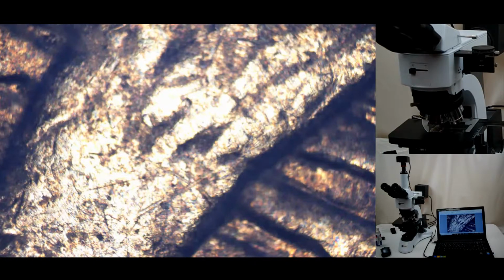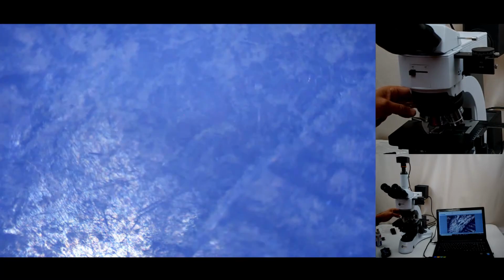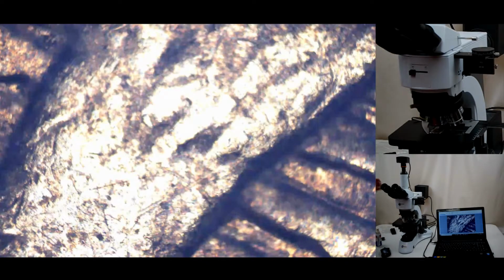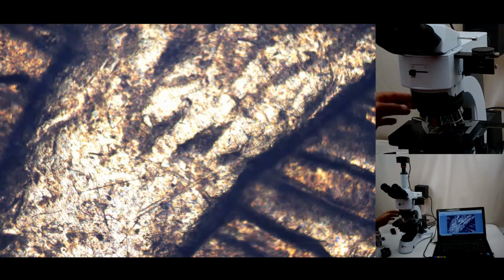So in this part of the video I would like to show you the image quality of this microscope in reflected mode for Brightfield imaging. And as you can see, the light at the top is on by using this switch, and 5x objective lens is in action. I'm using one of our filters, which is light balance neutral density filter. And you see the 5x objective lens in the monitor.